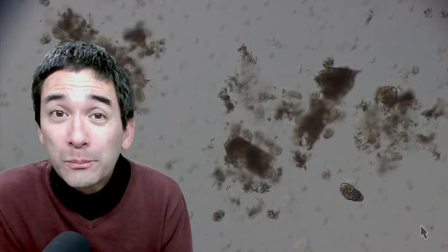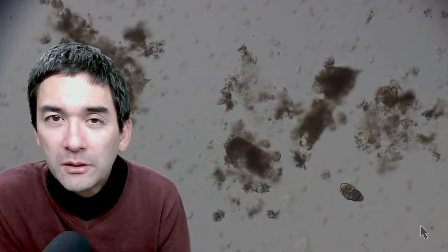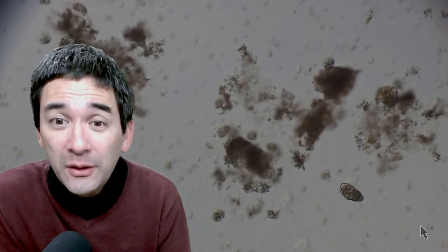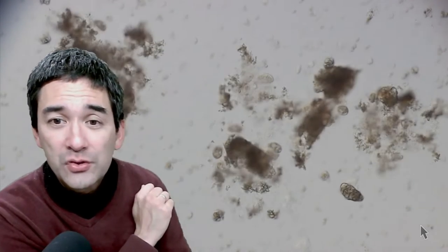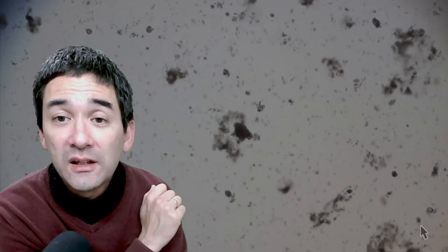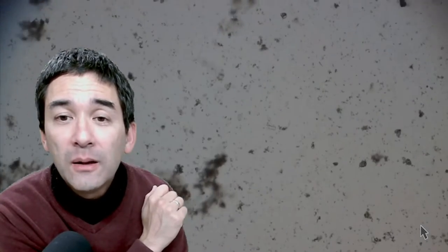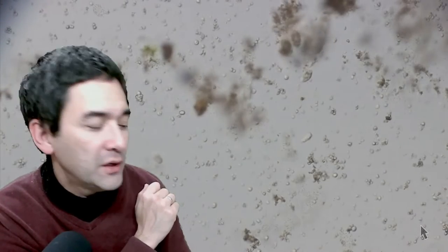To slow the movement of cells, there are several possibilities. You can buy a commercial product called Protoslo — spelled S-L-O — which you add to the water sample to slow cells down. Another method is to use very little water, squeezing the cells between cover glass and slide, limiting their movement. Or simply use a very high concentration of cells so there are always a few visible. Also, if you wait long enough, cells will start to accumulate on the sides where there is more oxygen.